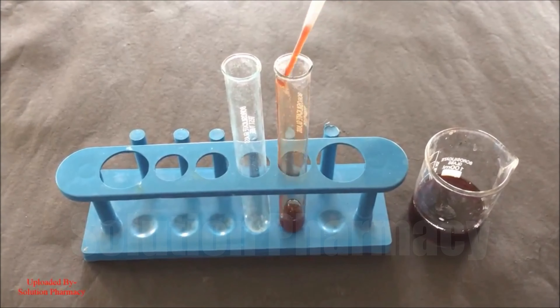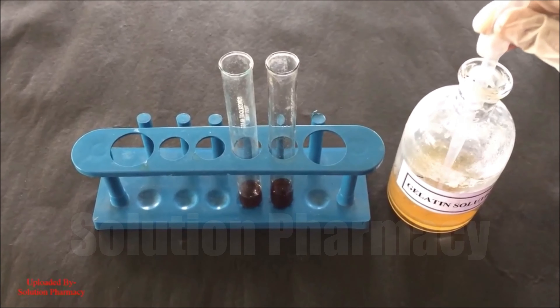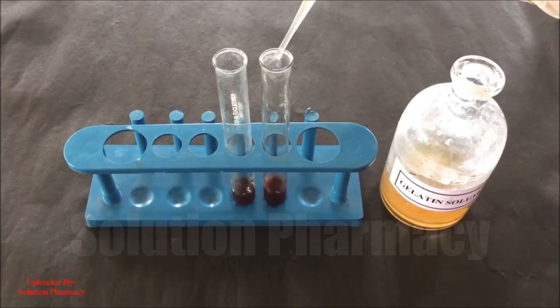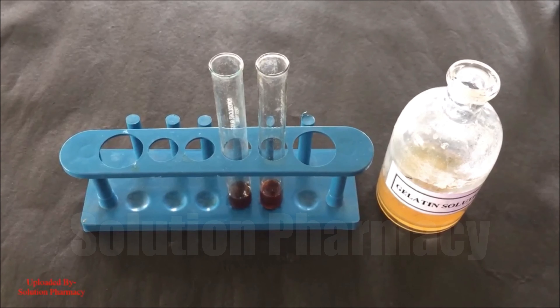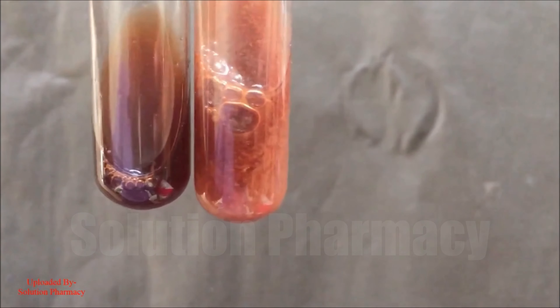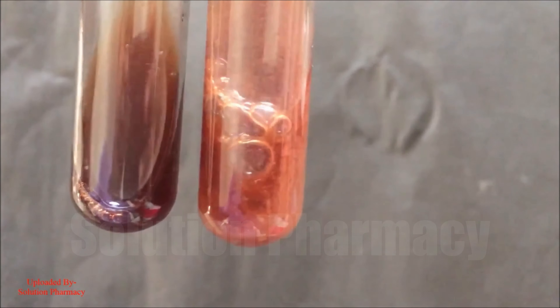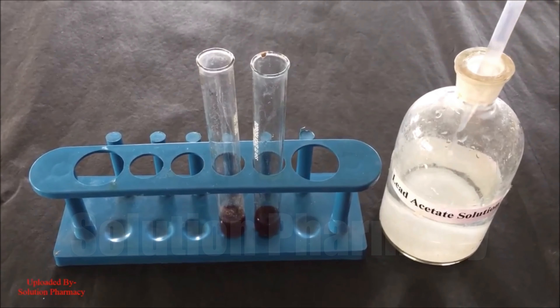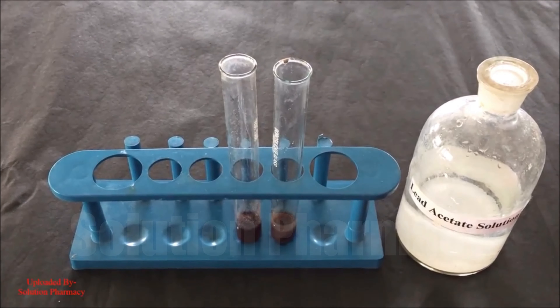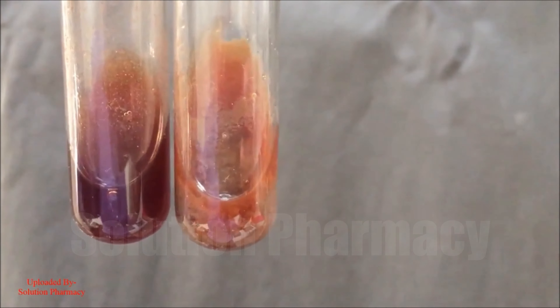For the gelatin test, transfer 2 ml of the extract into both test tubes, then add a few drops of 1% gelatin solution containing 10% NaCl to one test tube and compare with the second. Formation of a white precipitate after adding gelatin solution confirms the presence of tannin. For the lead acetate test, take 2 ml of the aqueous extract in both test tubes and add a few drops of 10% lead acetate solution to one test tube. Formation of a white precipitate indicates the presence of tannin in the extract.